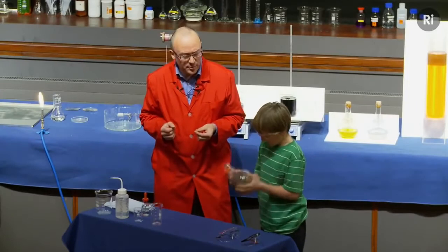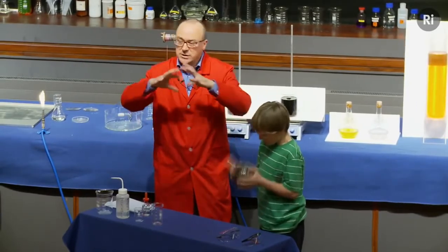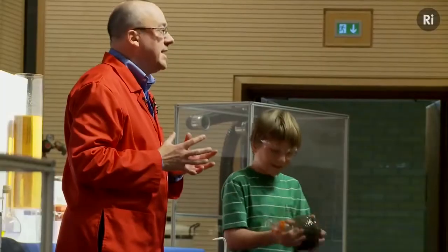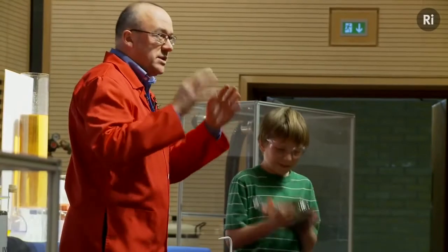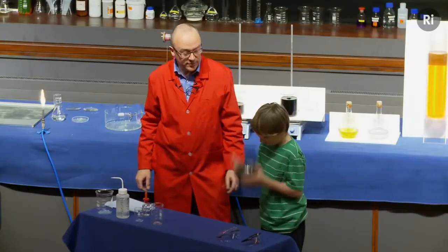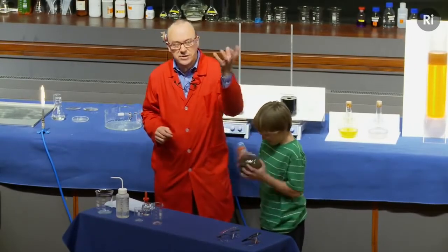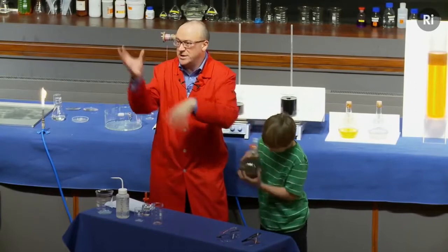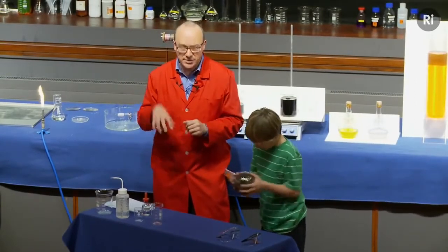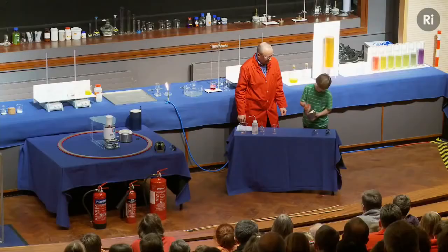What we're hoping is going to happen over the next minute or so is that those particles of silver will start to stick to the walls of the flask. And as they build up, we should see silver metal in the form of a mirror building up on the inside of the flask. And you'll all have seen those sort of decorations that you get at Christmas, those spheres that are shiny, and they're made using this chemical reaction. The little balls of glass, and the inside is coated with silver using this kind of chemistry.